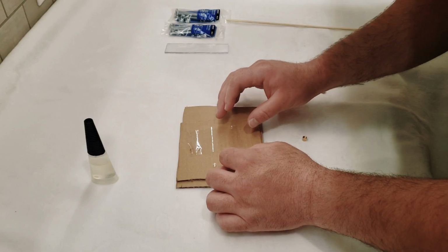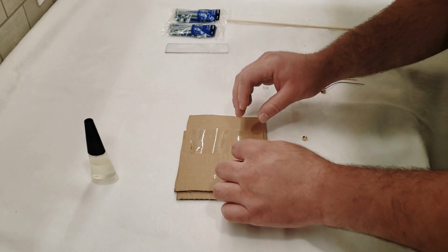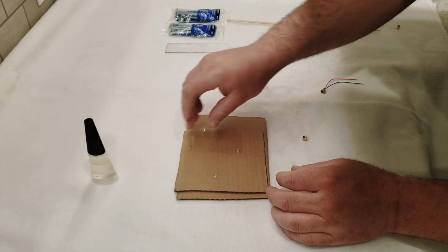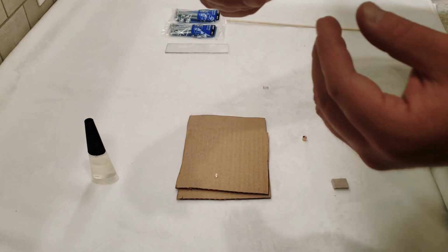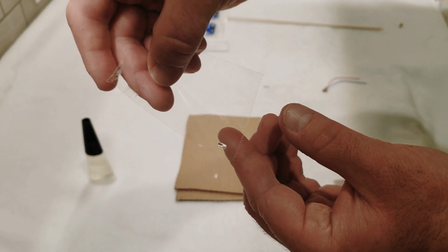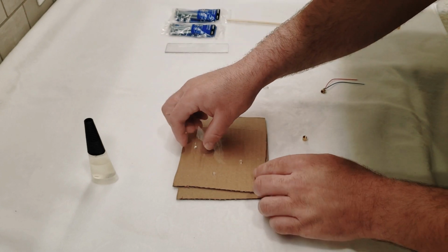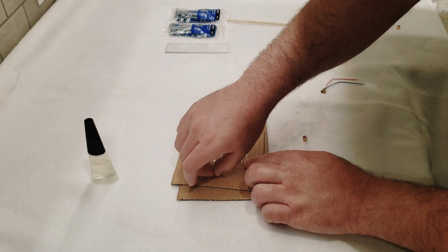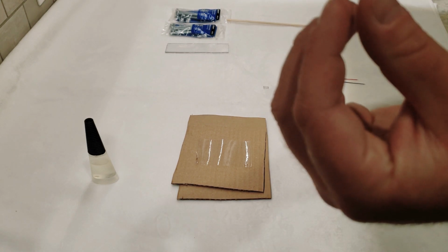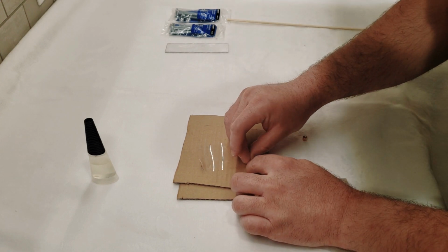So what we want to do next is essentially set this lens on its side on the tape there. So if you can see that, I've just set it kind of on its side against the tape, so it's sitting there. And I'm going to come in and grab the second lens, make sure I've got it facing the same way like that. So you want them both facing the same way and facing right against each other.